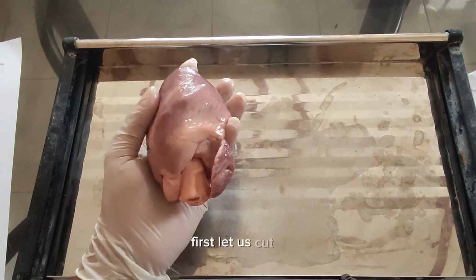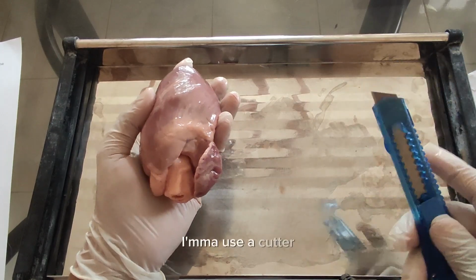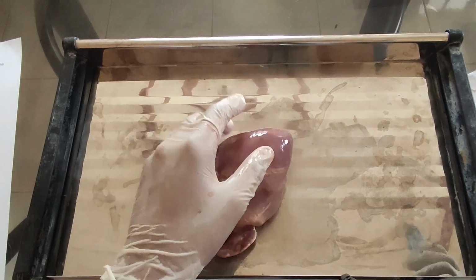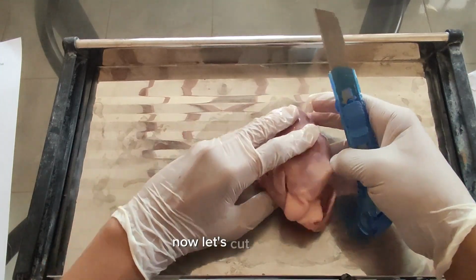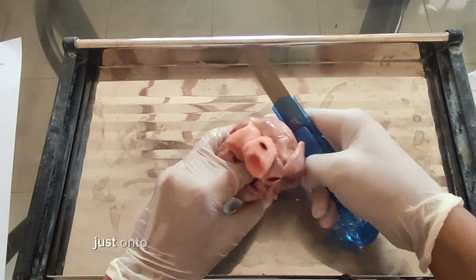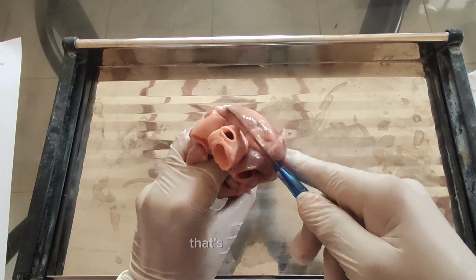First, let us cut it. I'm going to use a cutter because I think it will be effective. Now let's proceed. Hold on to your heart and then proceed on cutting it, just onto the side of the pulmonary artery. Cut it. That's right here.